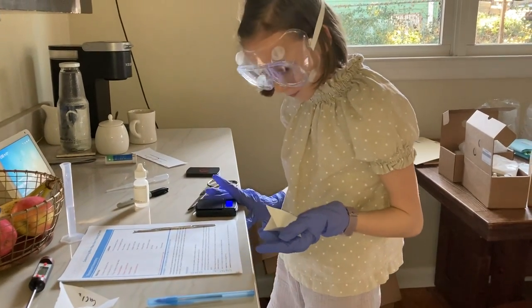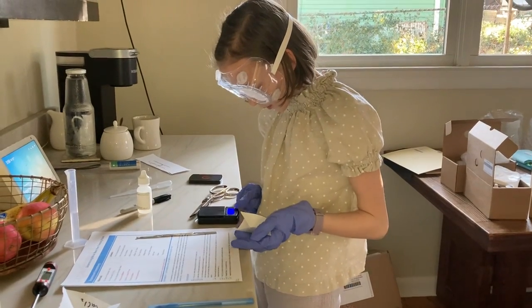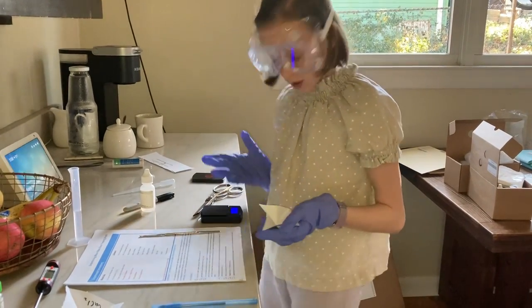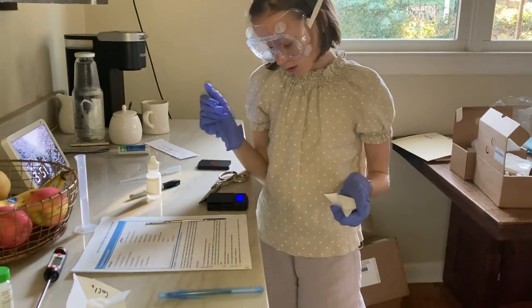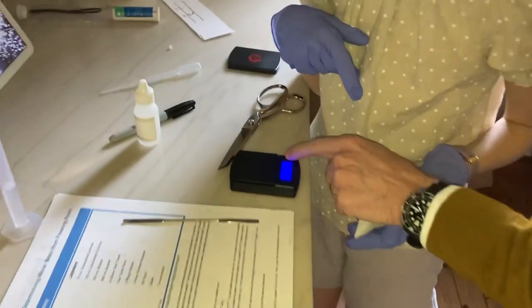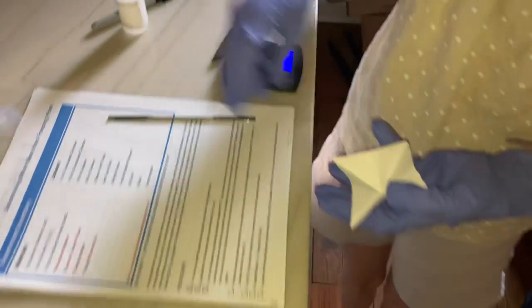Papa? Yes? Can you look at this? It says 1 gram, 1.0 grams. Of what? Nothing's on it. Oh, in that case, we just, we hit. If we hit that, it goes to zero. Okay, sure. Makes sense?